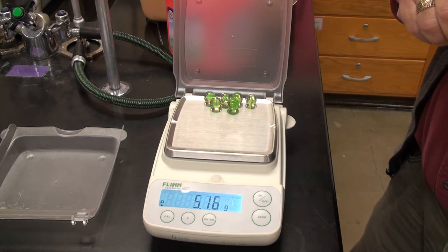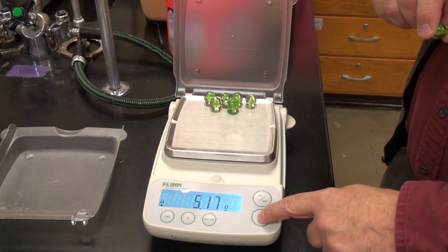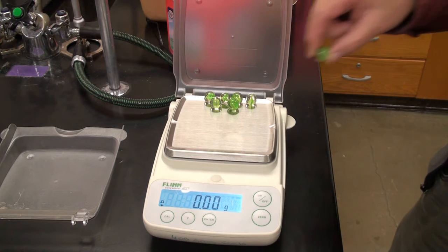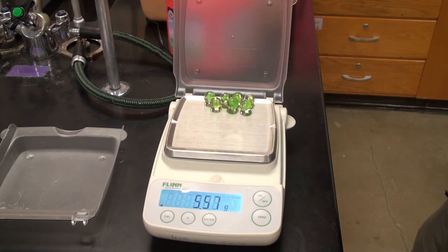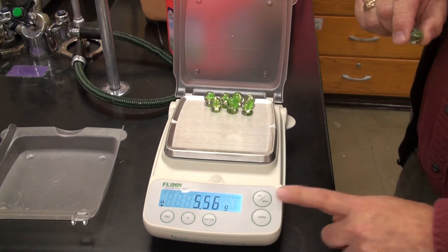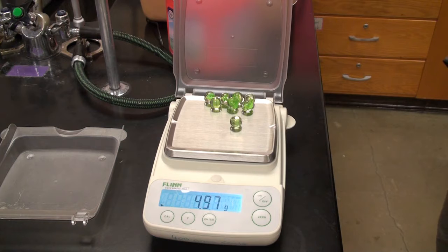There we go. Zero it. I'm going to wait a little second after I zero it this time. It looked like I was causing problems there for it. Zero it. And here's the last one. So that's 8 of them.